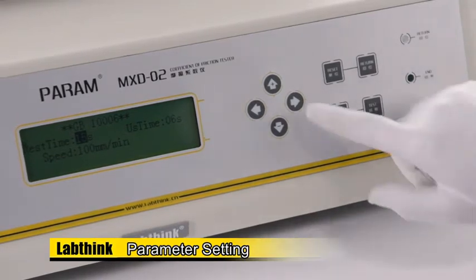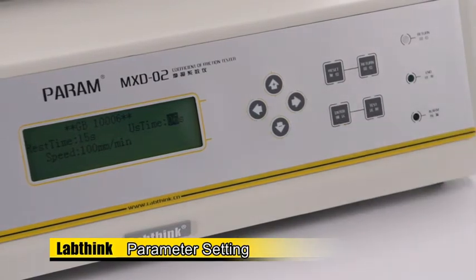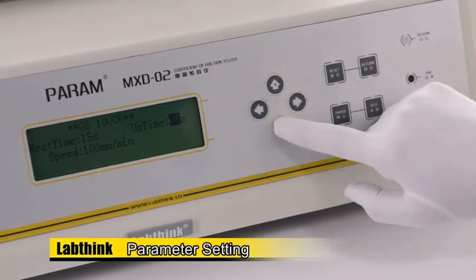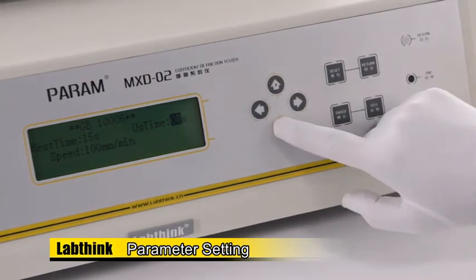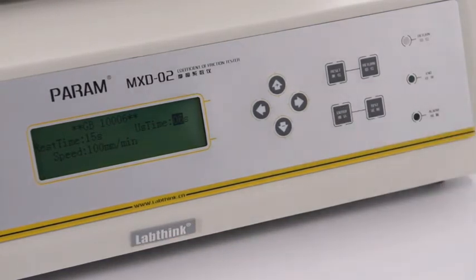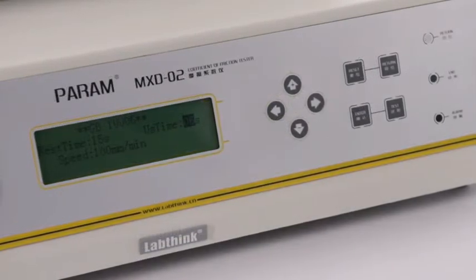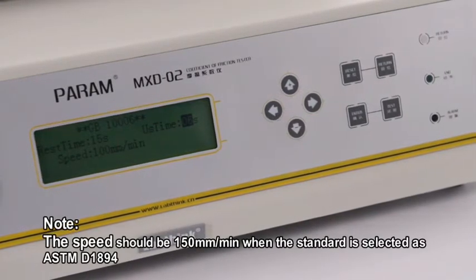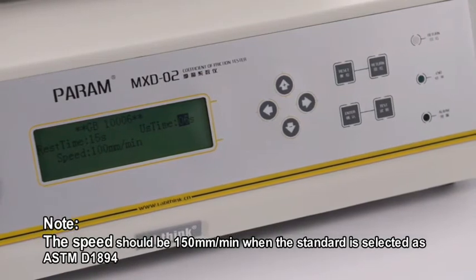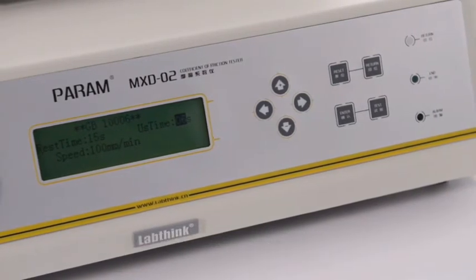Set US time as 6 seconds. The data collected in the first 6 seconds will be used to calculate the static coefficient of friction, and the data collected in the remaining time after 6 seconds will be used to calculate the dynamic coefficient of friction. The speed cannot be changed, which is 100 mm per minute, as required by GB10006 or ISO8295.